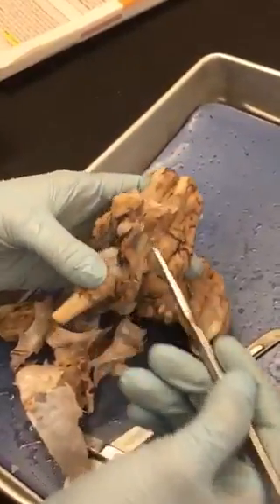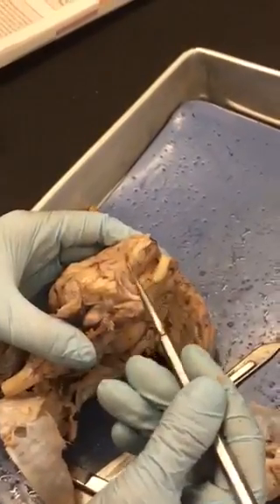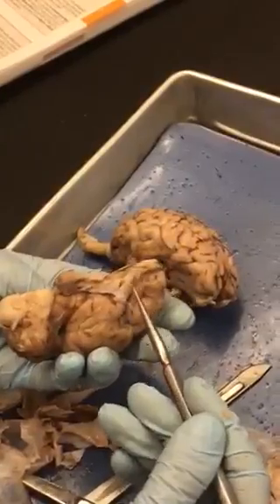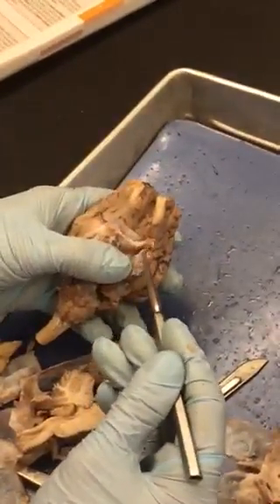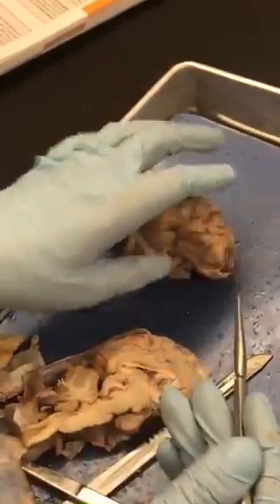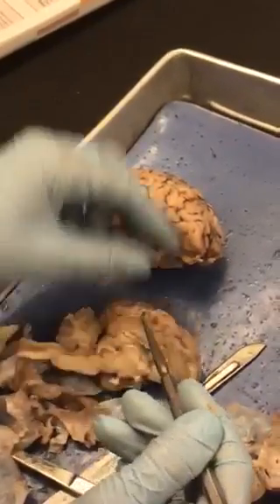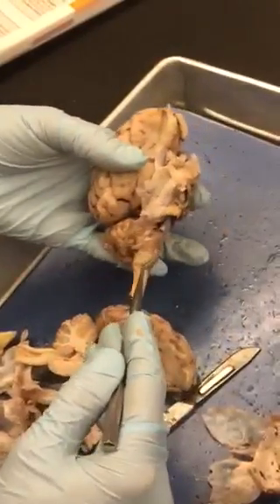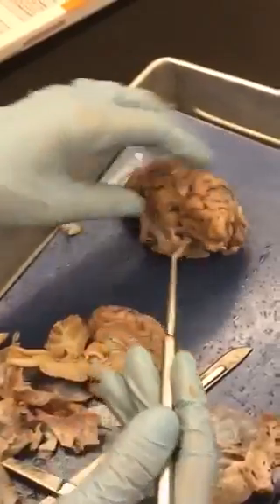Okay, if you look on the bottom side of this, you can start to see the olfactory bulb with the olfactory tract. You can see it a little bit better there, olfactory tract. And then you have the optic nerves that meet together to form the optic chiasm right here. Okay, so you can also see just a little bit of the remnants of that right here. Okay, and then you have the cerebellum, the pons, medulla, and that's about as much as you can see on that.